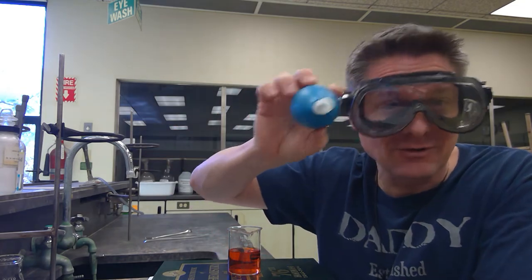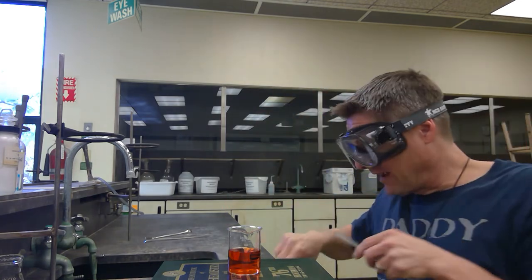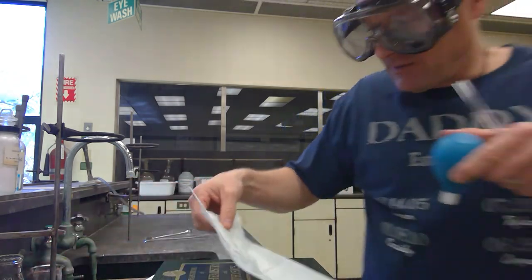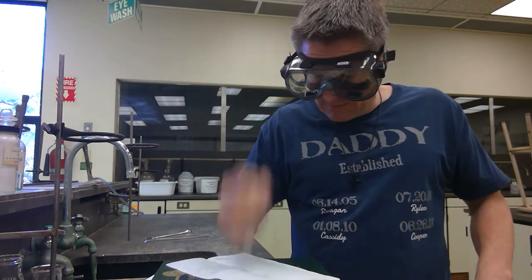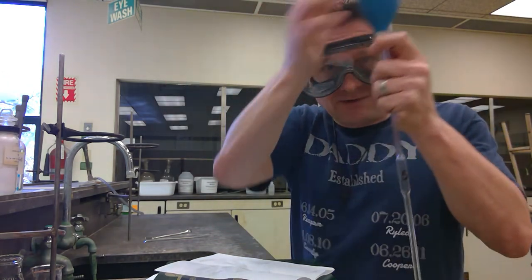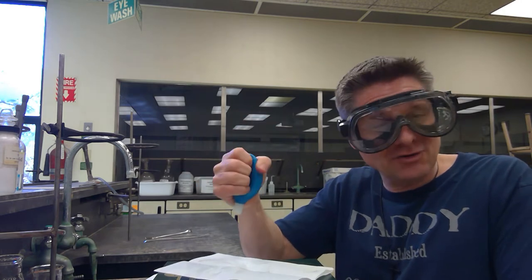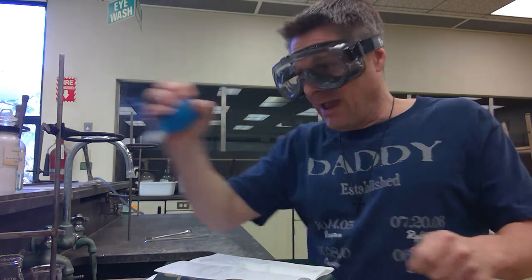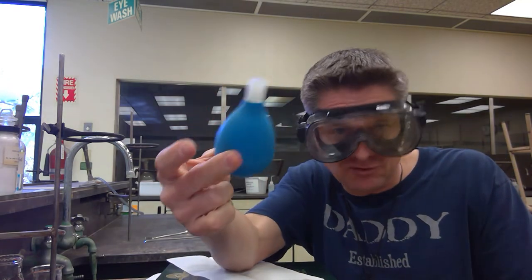One of the rules is you don't want to get liquid or solution into this bulb. Before I start anything, I'll always have a paper towel. I'll squeeze it, tap it, squeeze it — see if any liquid comes out. If it does, keep squeezing and tapping until all that liquid comes out. You don't want any liquid in there that dribbles down from the pipette bulb into the pipette — that would be bad. So always check. If you ever do get liquid in there — if you set it on and let go too fast — it can just suck right up the pipette into the bulb. Then you've got to get the waste container, get rid of it, tap it out. So be very careful not to get liquid or solution up in the bulb.